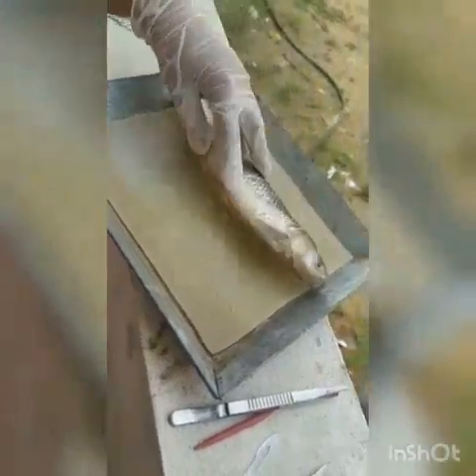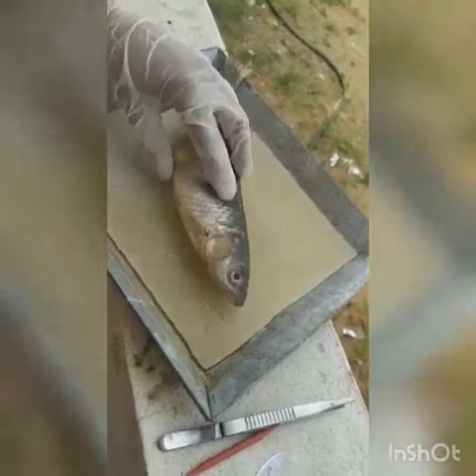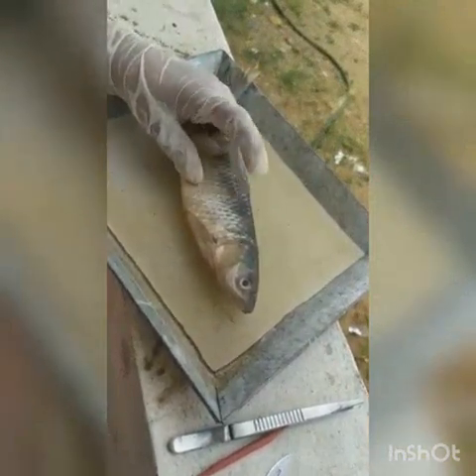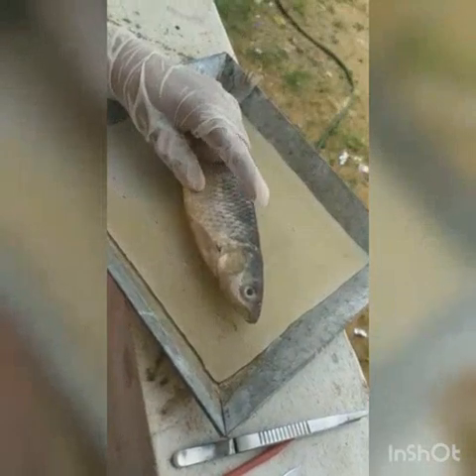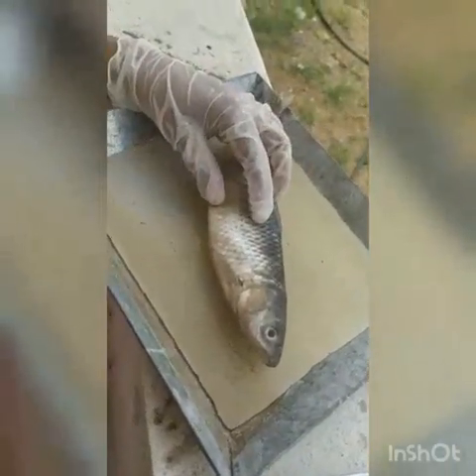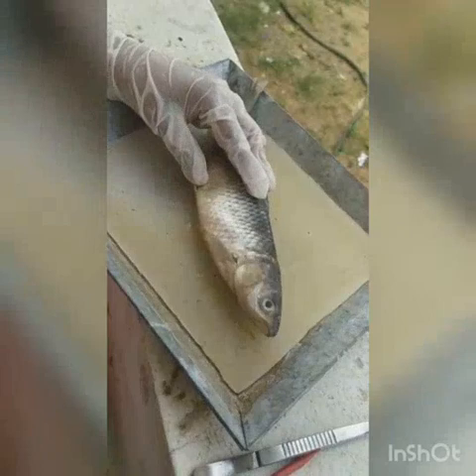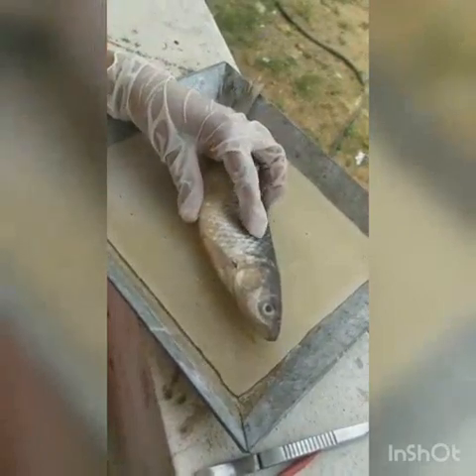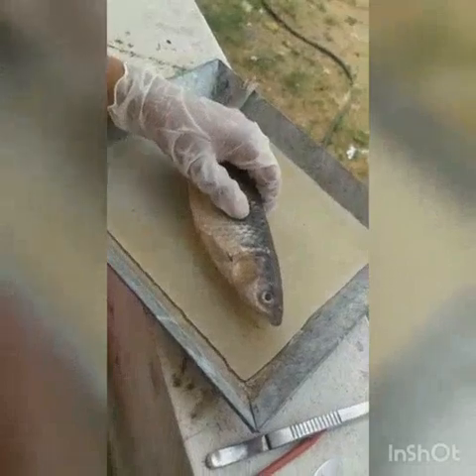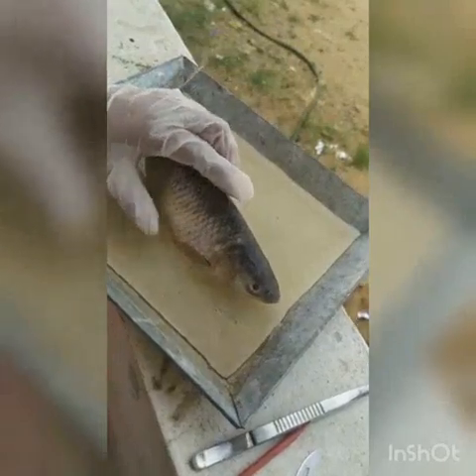Now we are talking about the dissection of the Weberian ossicles. The Weberian apparatus is found at the swim bladder, also called the air bladder. This Weberian apparatus is connected from the air bladder to the auditory system. It is an anatomical structure consisting mainly of four pairs of bones that enhances hearing by conducting pressure changes produced by externally originating sound waves from the swim bladder. We can say this Weberian apparatus acts as an amplifier for the fish.